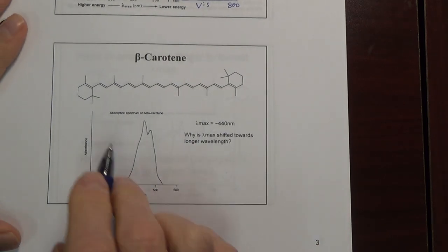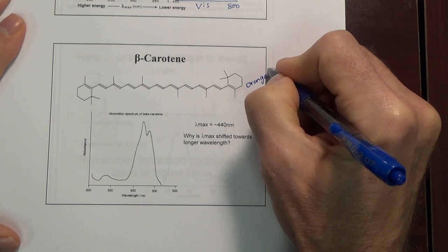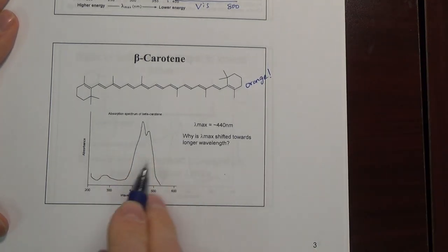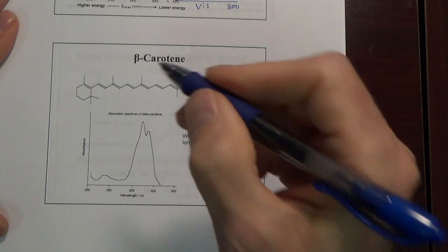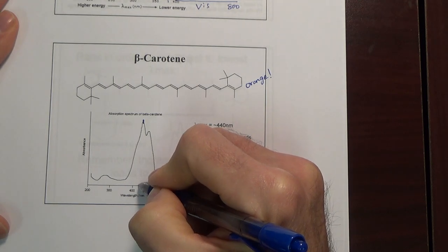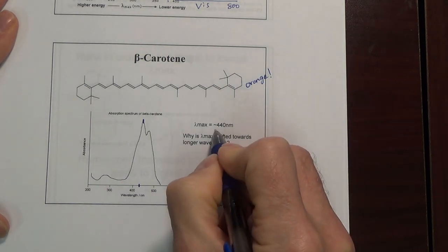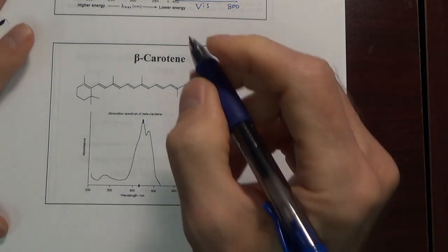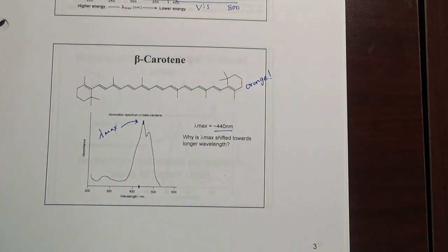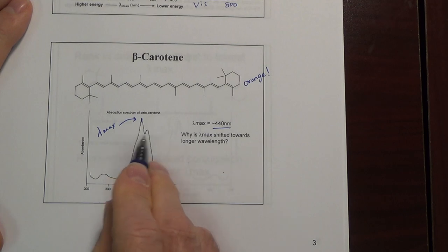On the other hand, beta carotene — this molecule — we know it's orange, like a carrot. Here's the UV-Vis spectrum. We see the maximum absorbance here, which appears to be about 430, and it's actually known to be 440 nanometers — that's our lambda max. We see it's shifted towards the right, towards a longer wavelength, and 440 is actually in the visible region.